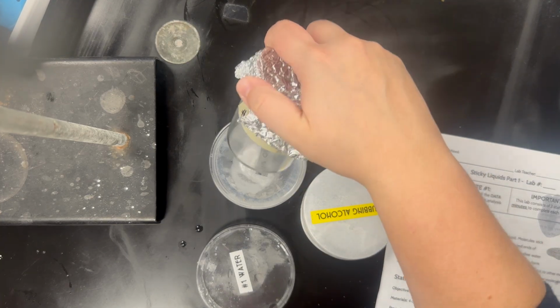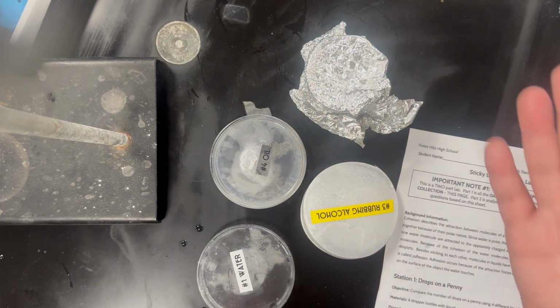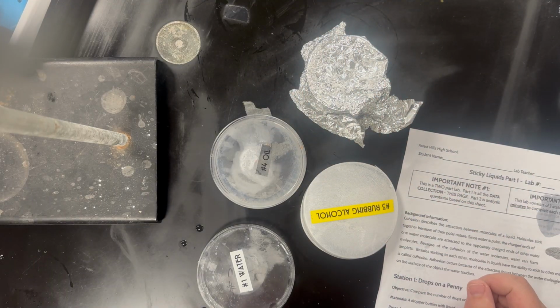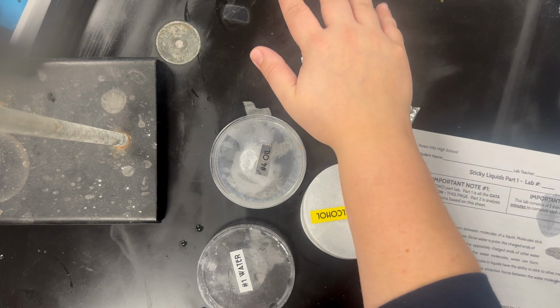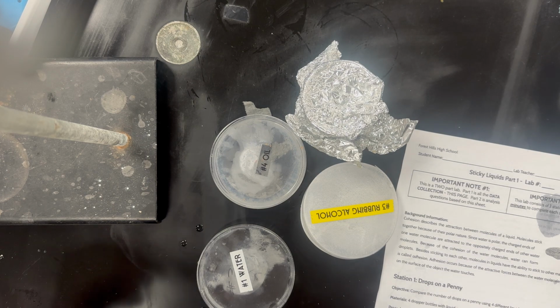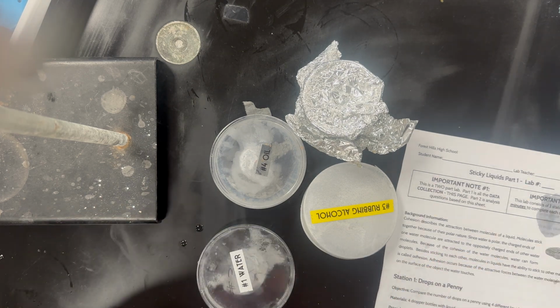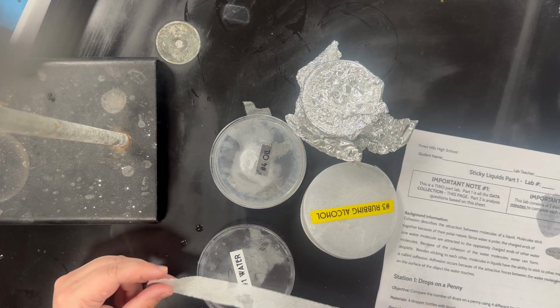What you'll notice is that acetone is going to be in a beaker with foil on it. Fun fact, it will dissolve the plastic of the Petri dish. It is also super important all these stay covered, especially the acetone, because it will vaporize and evaporate very, very, very quickly. Everybody, because there's 4 different liquids, pick one of them, and the other group mates should pick the other ones.